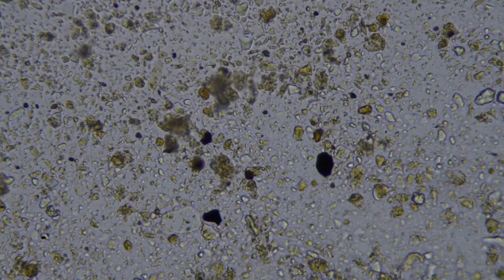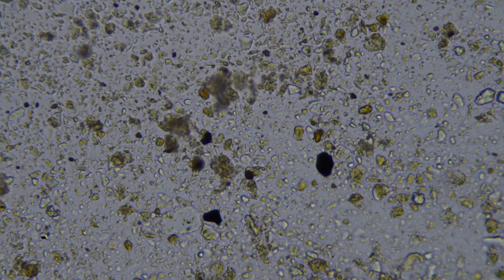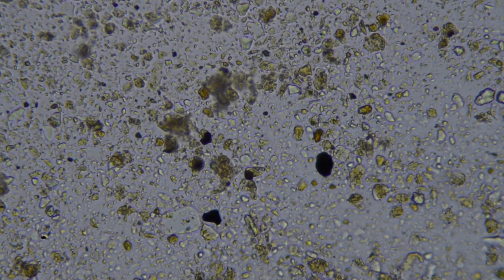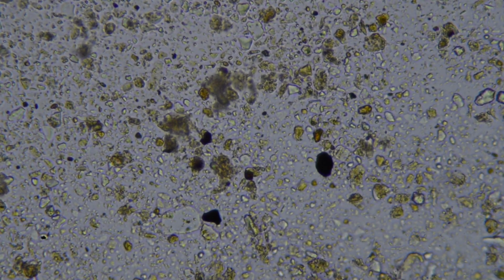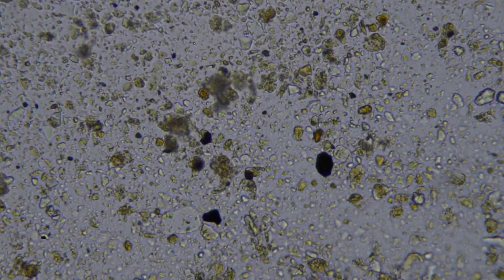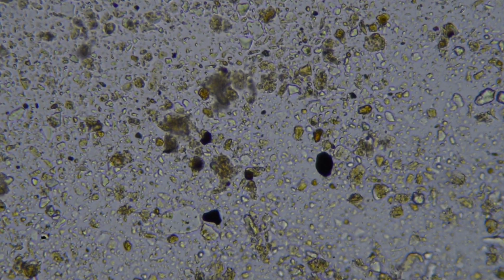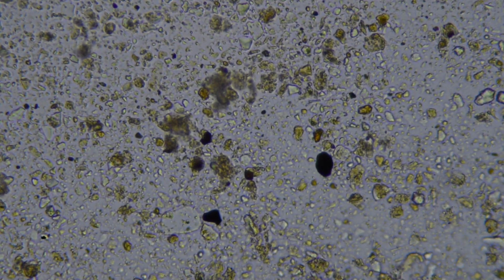So I couldn't resist taking a wee sample of the soil back home, just to have a look at the microbiology under the microscope. So I thought I would send you a video, as I thought you might find this interesting. So very briefly, here is the soil right now, and this is times 400 total magnification, so times 400 what you can see with the naked eye.